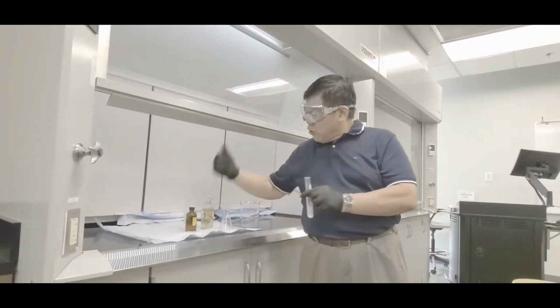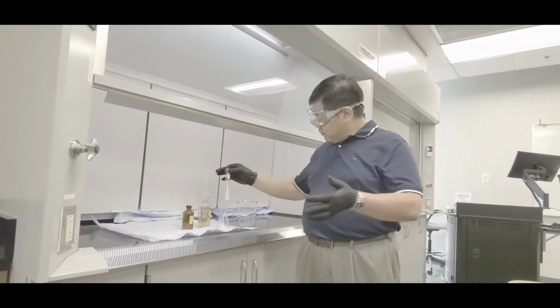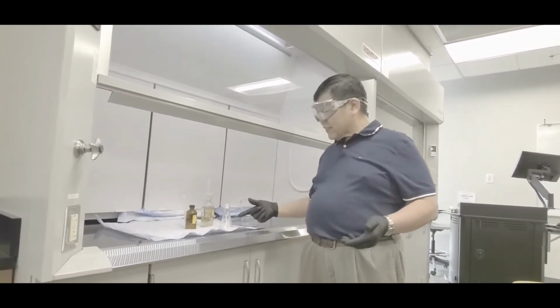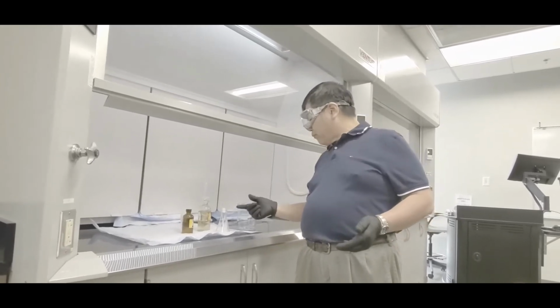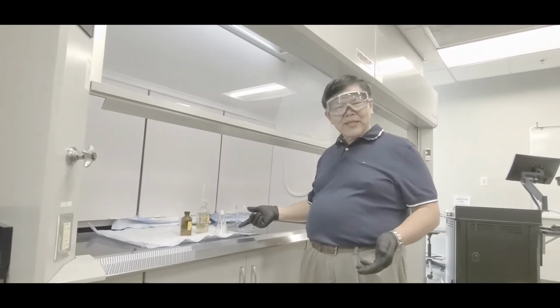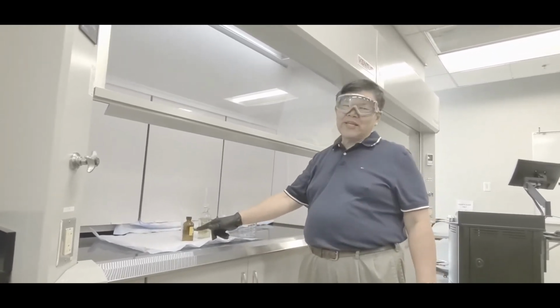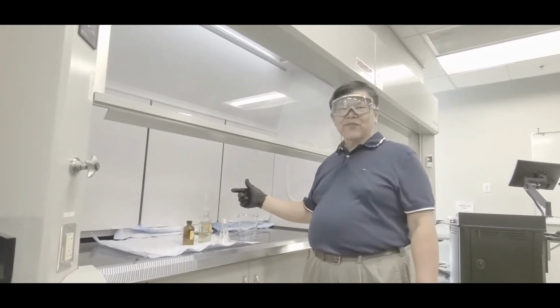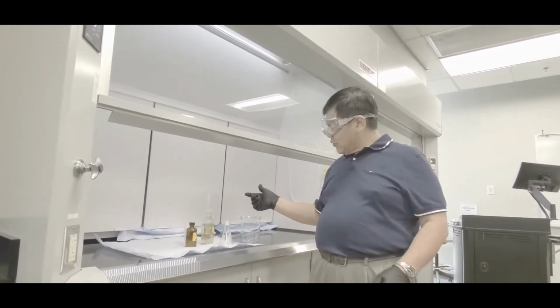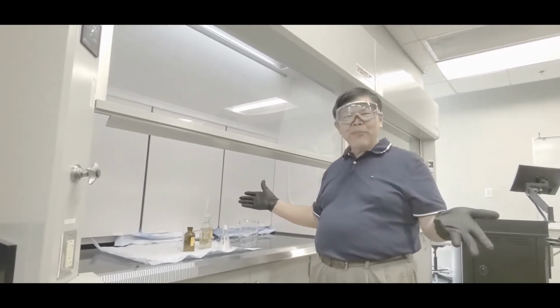Don't do this, because what happens, you'll get that stuff on your hand. Understand? So, all right. So now you've got the salicylic acid, and you put in 0.4. You have 0.4 grams of salicylic acid, about 0.9 milliliter of acetic anhydride, and about, say, 3 or 4 drops of phosphoric acid, okay? So in that case, we're done with the mixing. The next step would be cooking, okay? I'll be back when we start cooking.